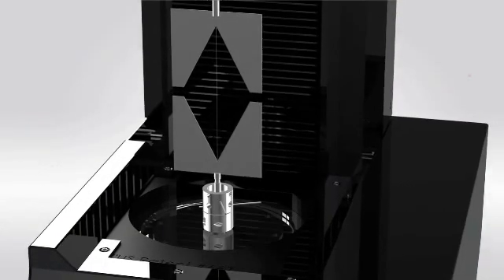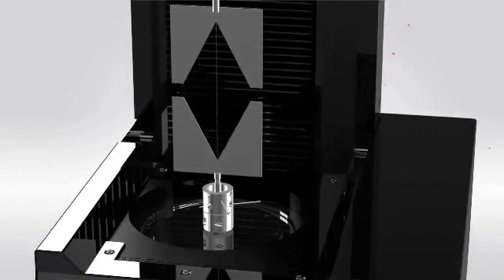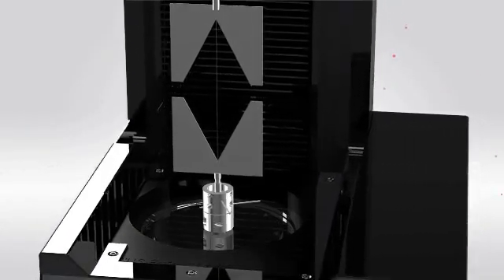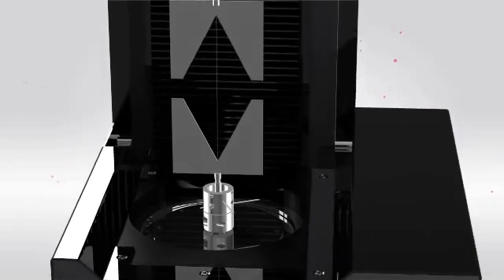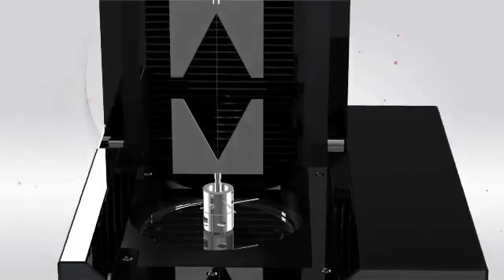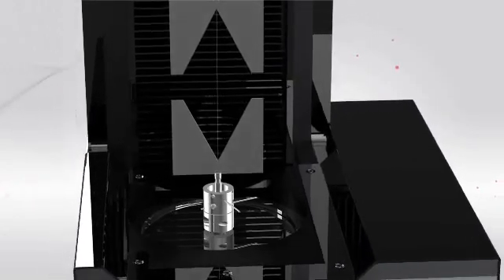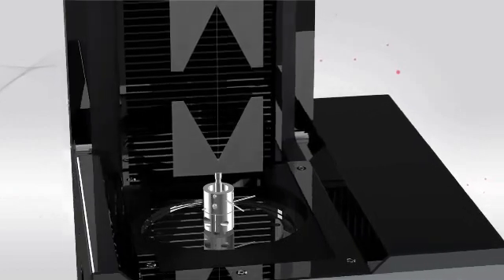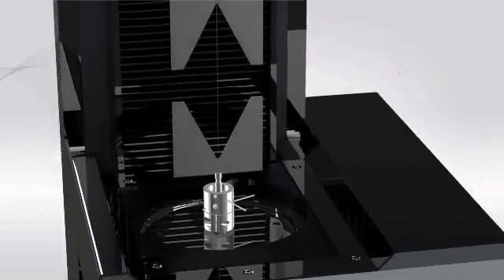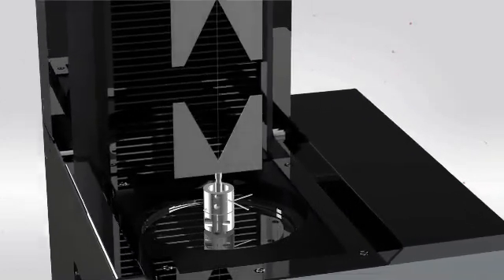Sample mounting for the T150 UTM is made easy with the use of paper stock templates, compression platens, and a bending apparatus. Force loads are developed in the µN range, and strain measurements from nanoscale extensions of samples are possible.